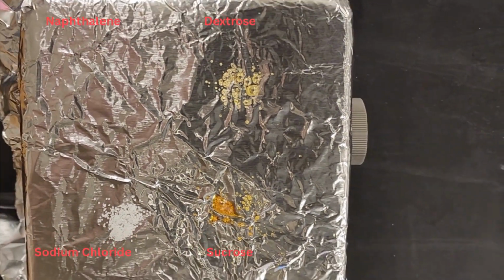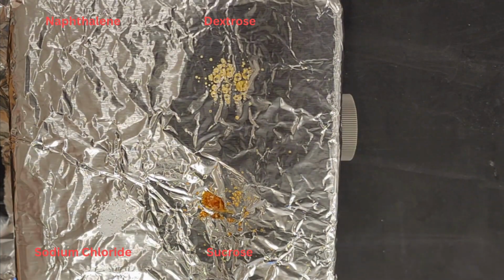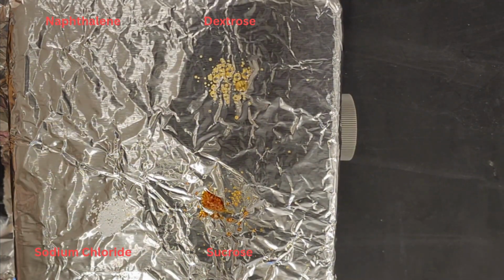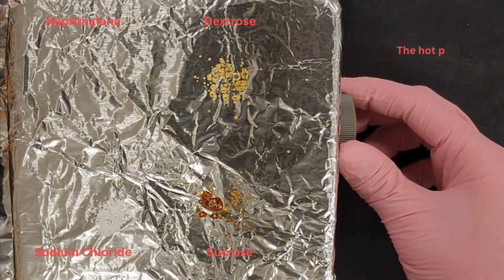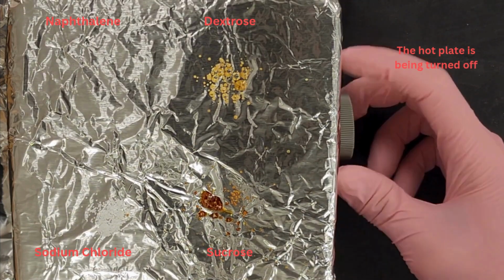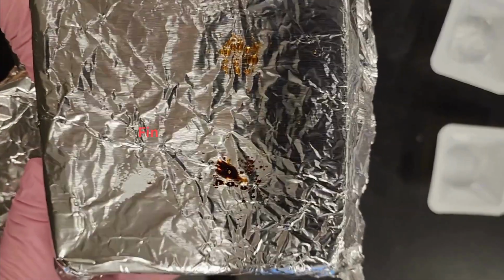As you can see in the sped up portion of the video, the dextrose and the sucrose quickly began burning on the hot plate. I was waiting for the sodium chloride to begin showing any signs of melting, but about 6 minutes had passed and it wasn't doing so, so I decided to turn off the hot plate. You can see here the final results of part 1.